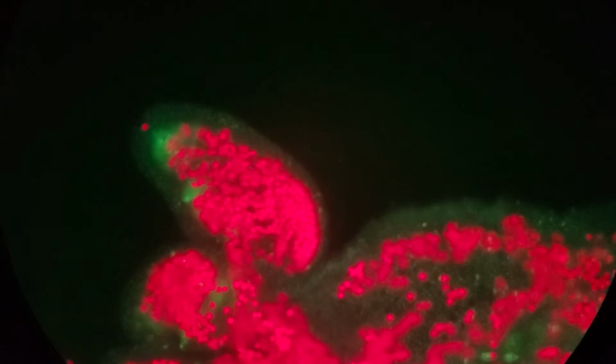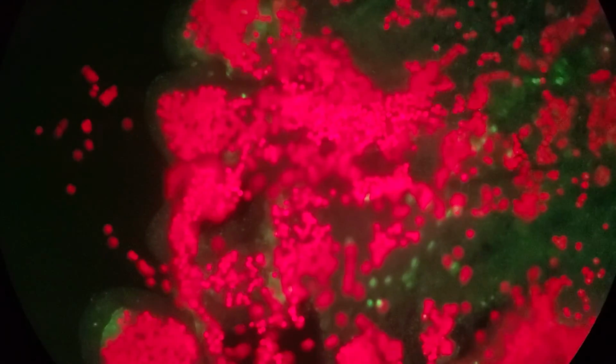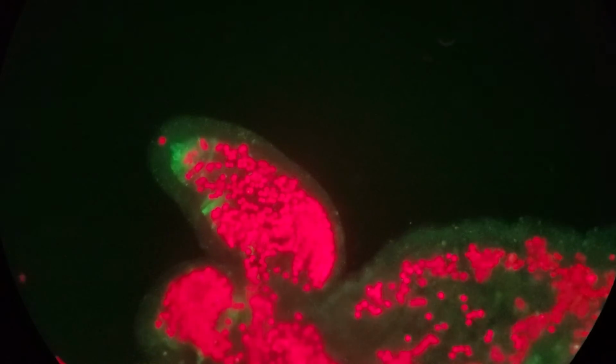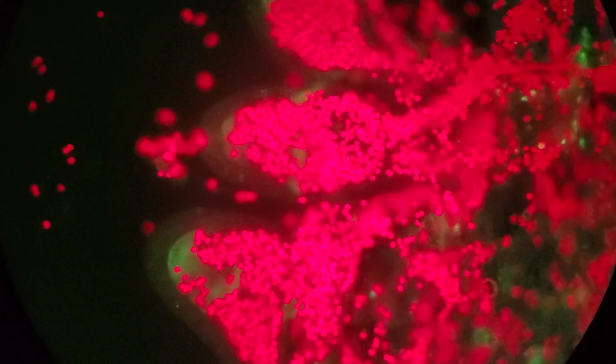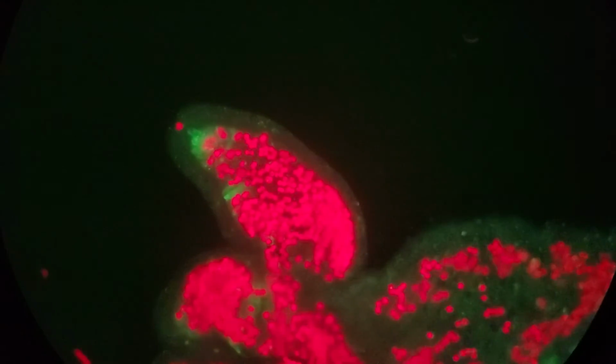And then here is... I don't know what this is going to look like. Here's violet excitation. Oh, you can see both in violet. That's awesome. I mean, I've done this before, but I forgot what it was going to look like. So now you can see the host tissue glowing in green, the algae glowing in red. And this filter is allowing green and red light, probably something like a yellow filter.